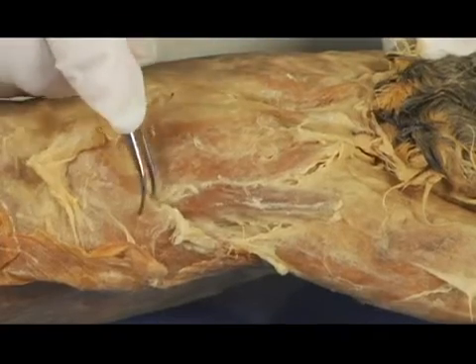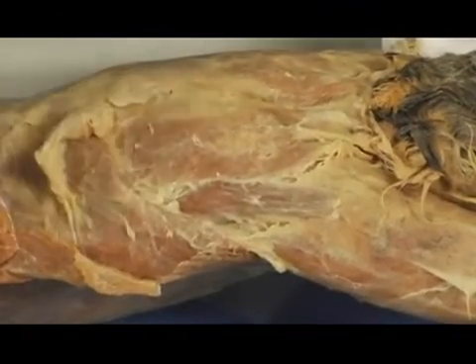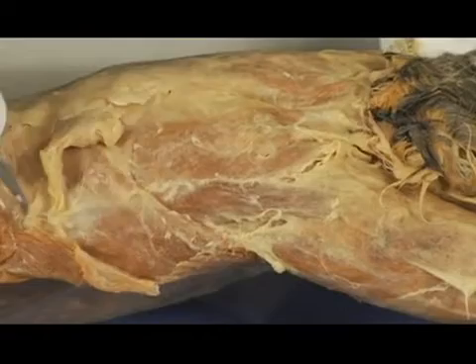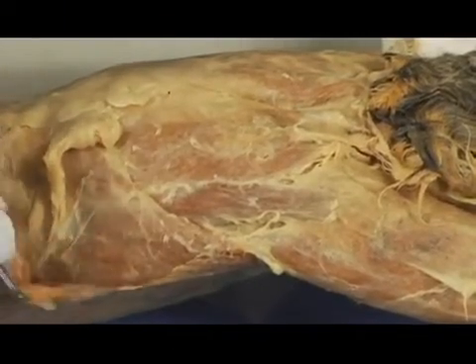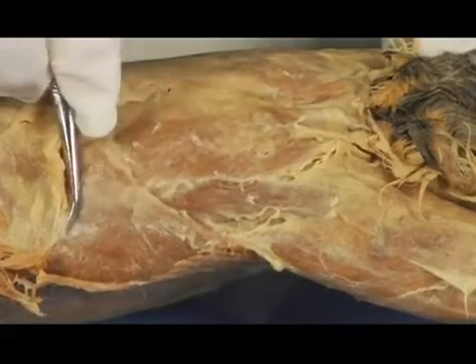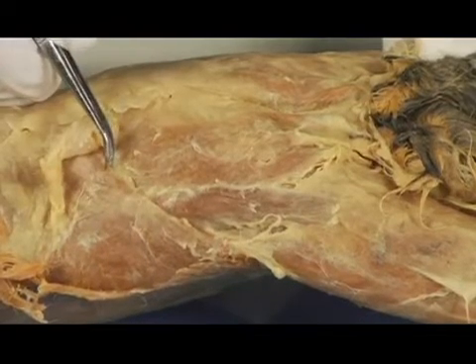Okay. Now, this muscle below it, which I'm going to take a little bit more tissue from so that you can see it, try to get some of this fat off of there. Try to define it a little bit more. It's very, very large. I'm removing a little bit of superficial muscle here. But I'm talking about this muscle that's below the spinodeltoid muscle. It's this large muscle right here. And this is something that actually helps, again, to move the arm, and it's called the latissimus dorsi.